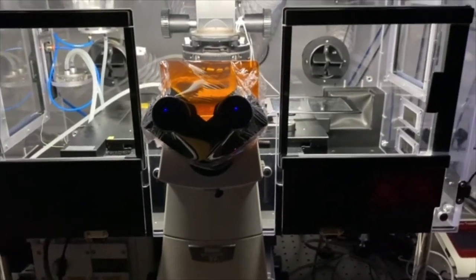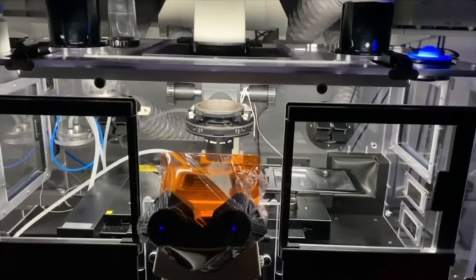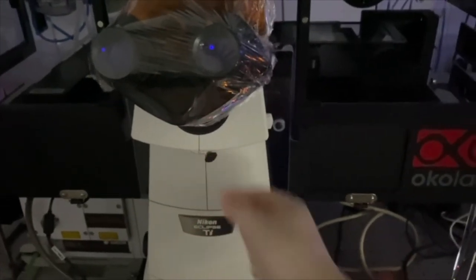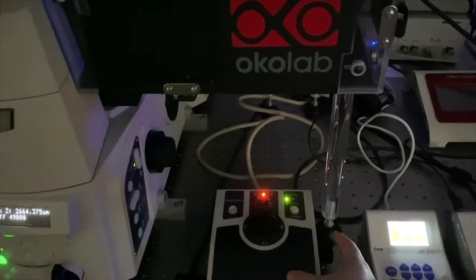Switch the box light off as well by stepping on the panel again. Now look down the eyepiece and start focusing on your cover slip using your chosen contrast — in my case DAPI. Make sure the toggle is on the right before you start. Place your hand on the wheel, look down the eyepiece, and turn the wheel towards you until your DAPI signal comes into focus.